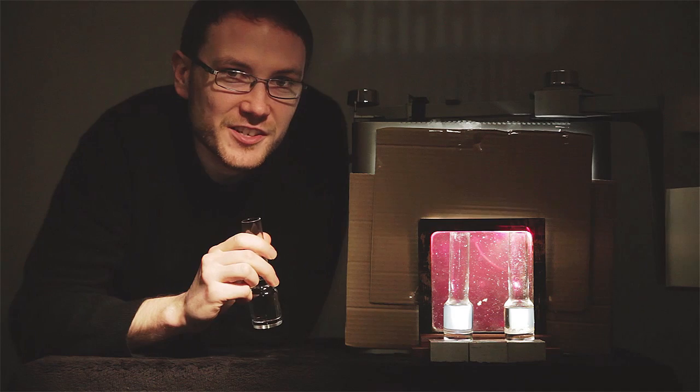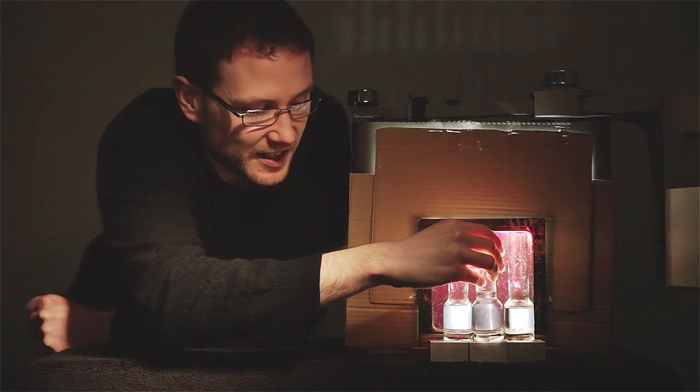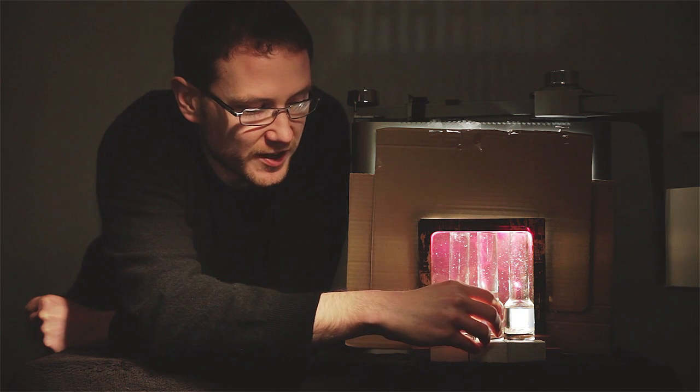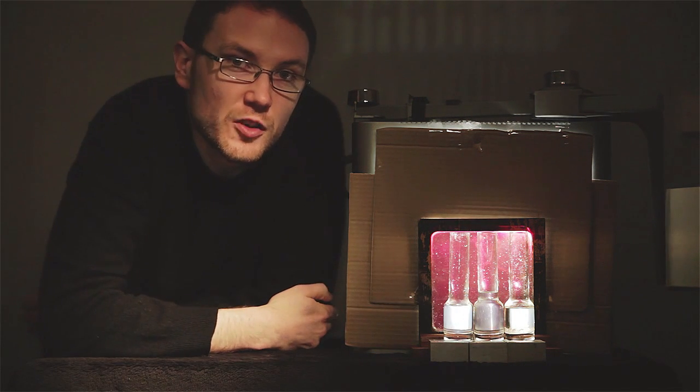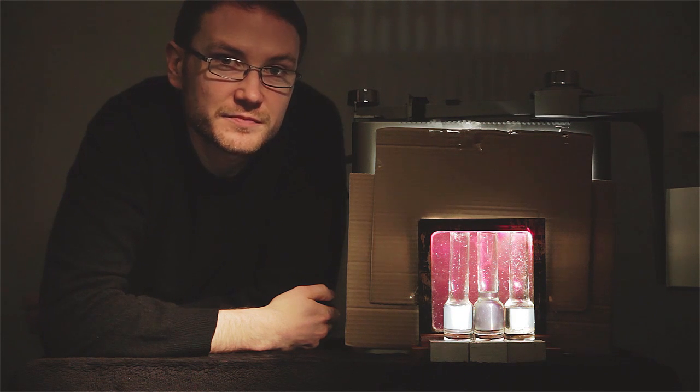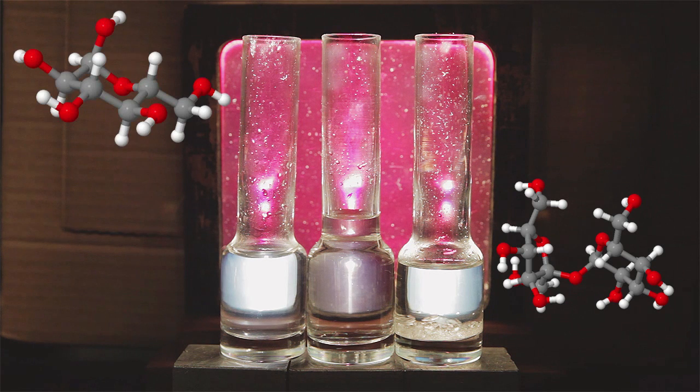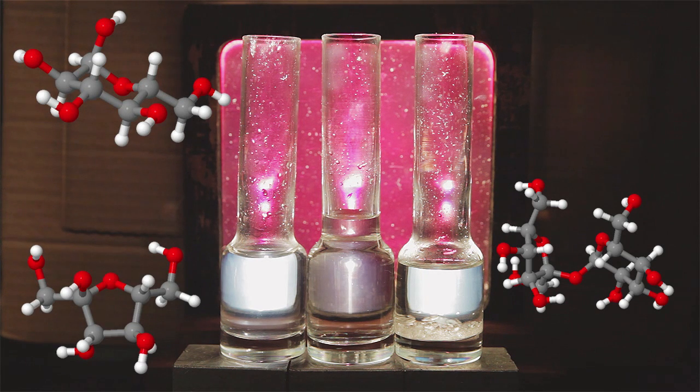Now here's a cool extension. This solution here starts off exactly the same as the sucrose solution on your right. I added a few drops of lemon juice, and then boiled gently for about five minutes. Sucrose is a disaccharide of glucose and fructose. What I've done is to begin hydrolyzing it.